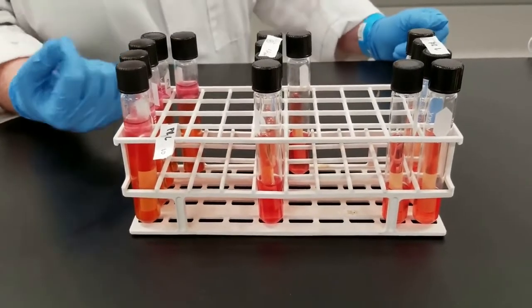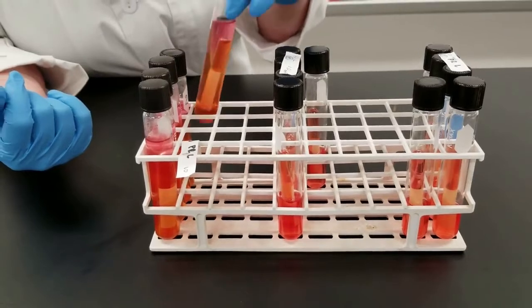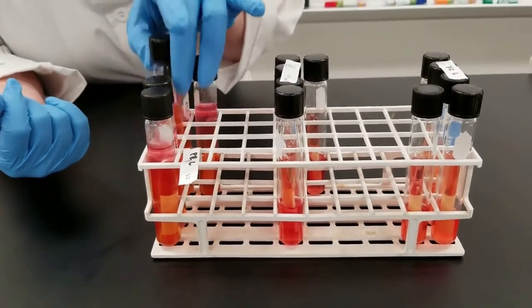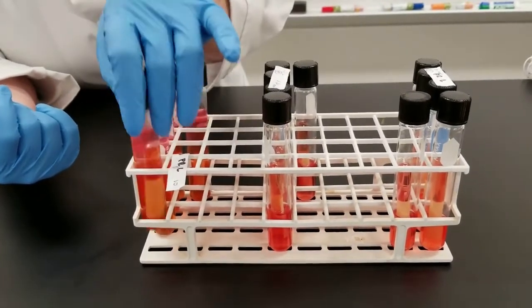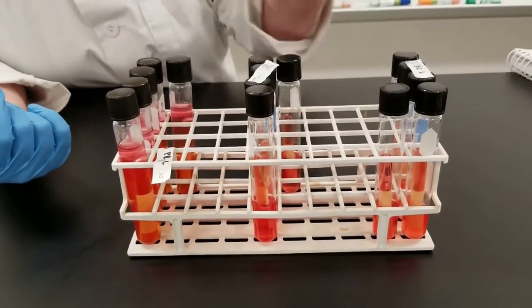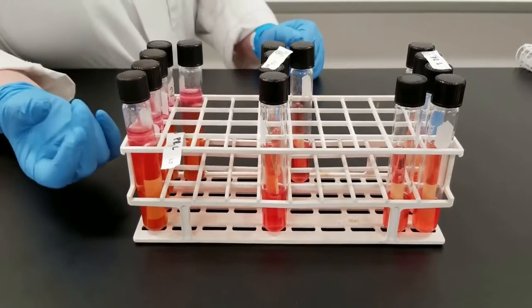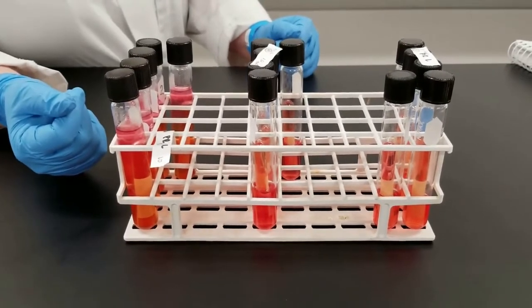On these particular samples, you will notice that none of them have turned yellow. It is possible if we left them a little bit longer, they might, but on the other hand, it's good that this obviously is a fairly clean water sample in terms of enterics that may be present in it.